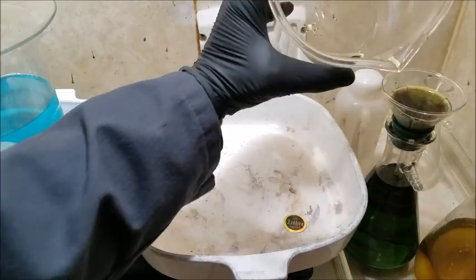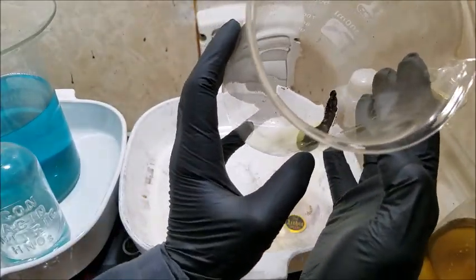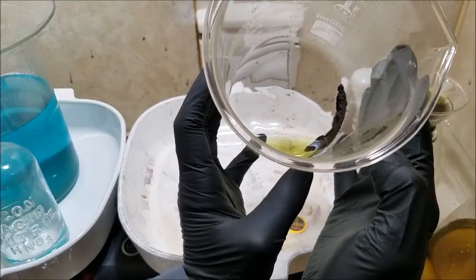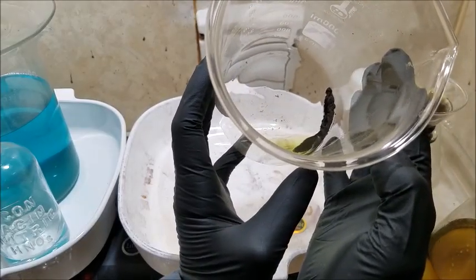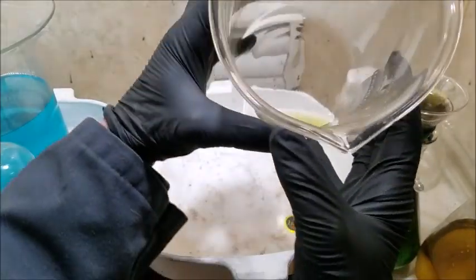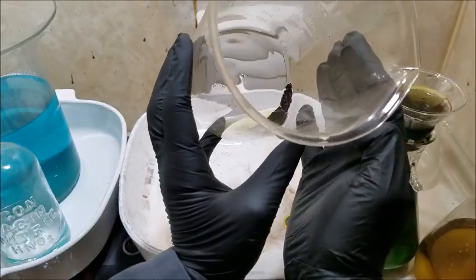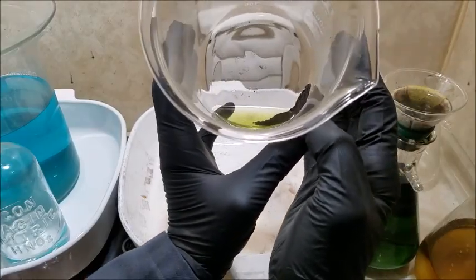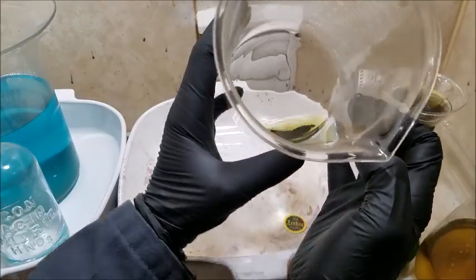I can't remember exactly what went into that batch, but I do know there was some gold-plated jewelry. I don't think there was any gold-filled. I don't remember throwing any batches of carat scrap in there. But I'm not 100% sure what else dropped out of solution, if that could possibly still be some iron. Maybe. I don't know.